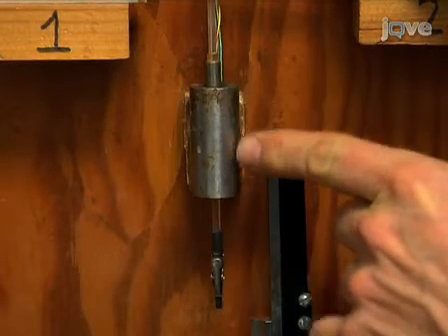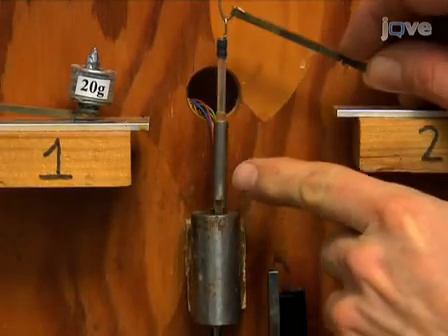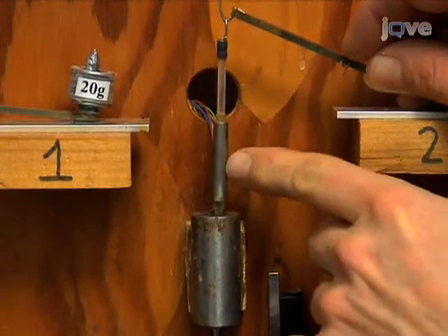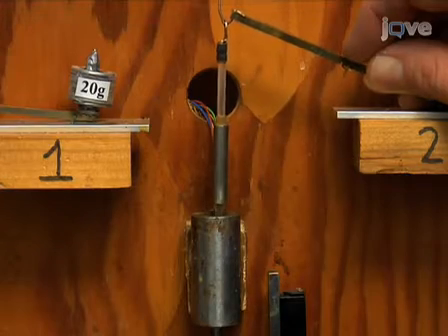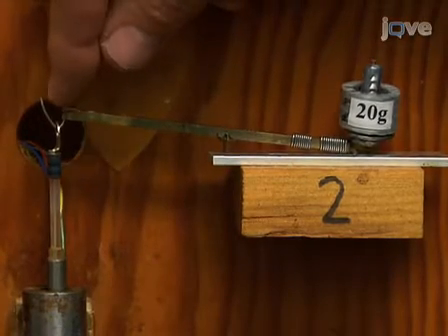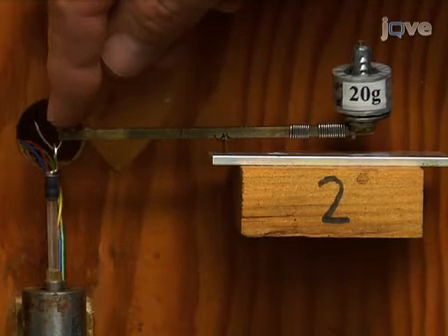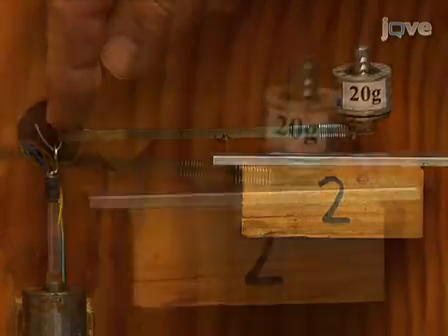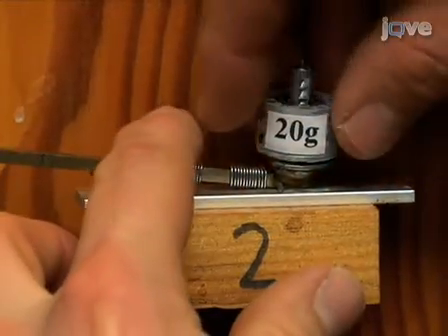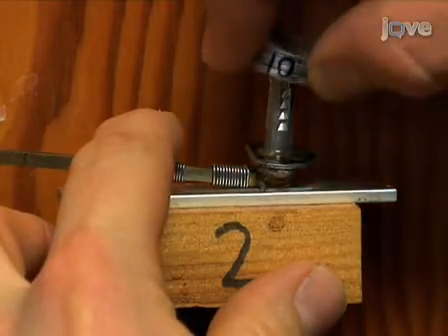an LVDT, or linear variable differential transformer, that electronically detects the position of a small metal cylinder or core that is attached to the rod. The upper end of the rod is linked to a lever with an adjustable counterweight. This lever exerts an adjustable amount of upward force on the wall sample. The force is adjusted by adding or removing calibrated metal weights to the far end of the lever.